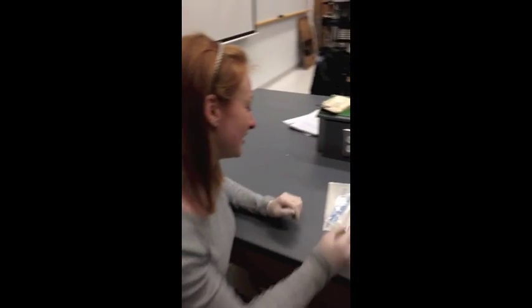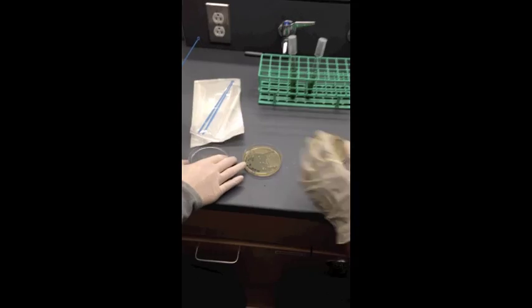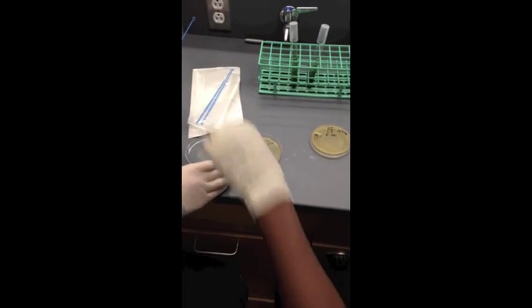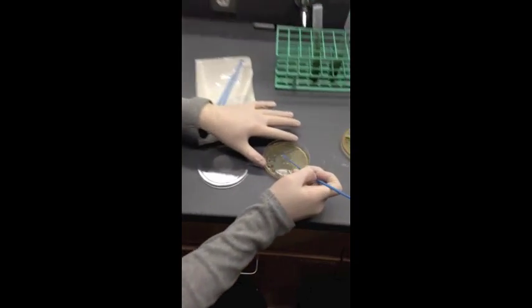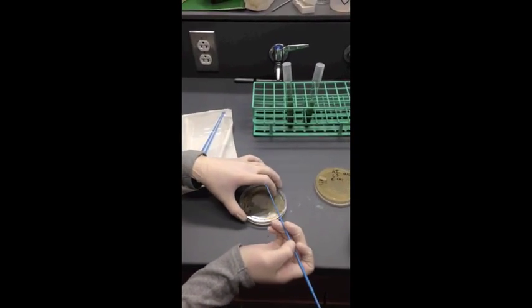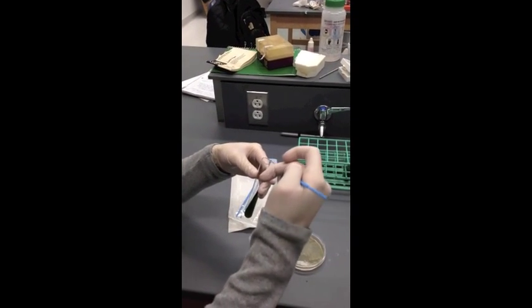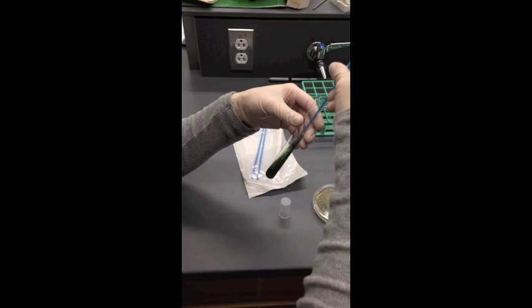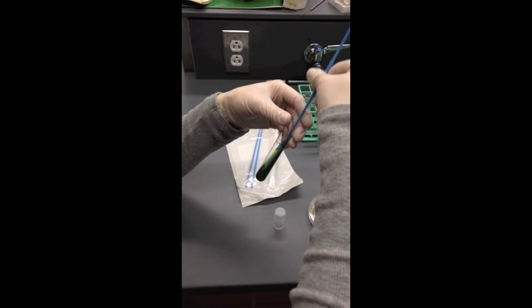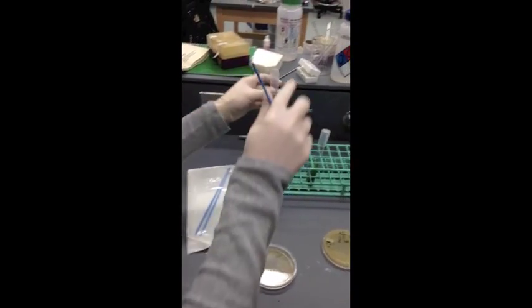Would you like to do the other one, Cora? Sure. So I take this loop and take the plate... Wait, Cora, you need to put the cover face down because that's proper aseptic technique. Okay. Then I take one bacterial colony — perfect. Don't forget to close that before you open another one. And this is the Enterobacter — yes, and you're inoculating it right now. And just dispose of that right here.